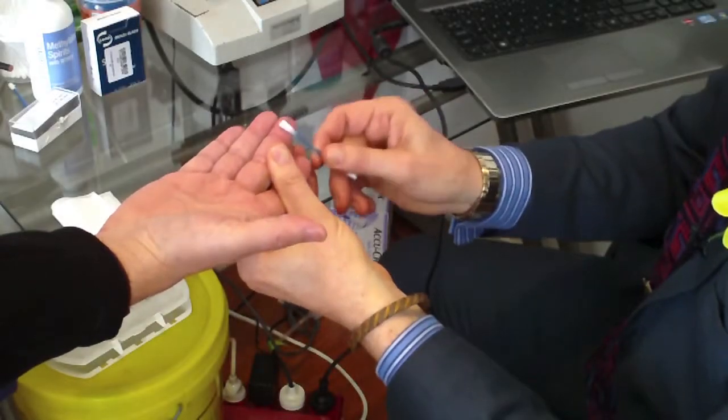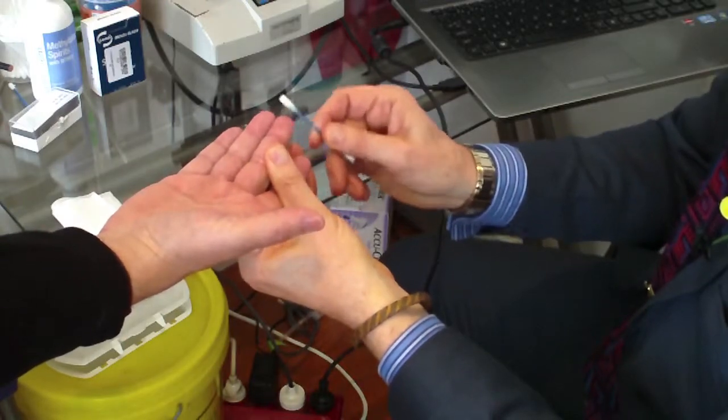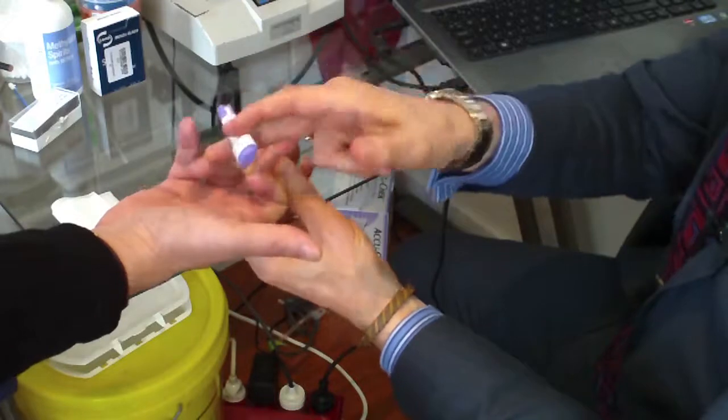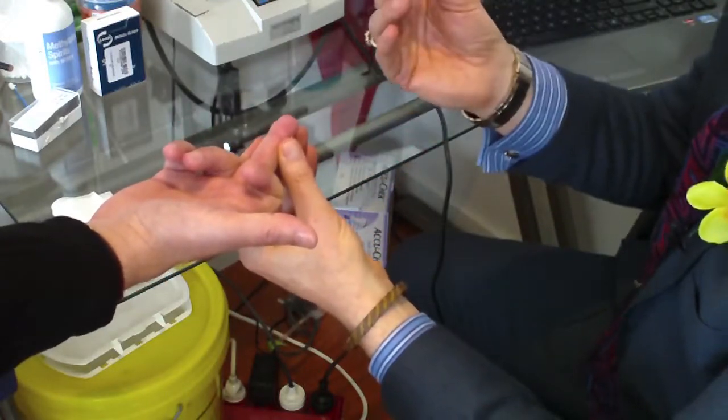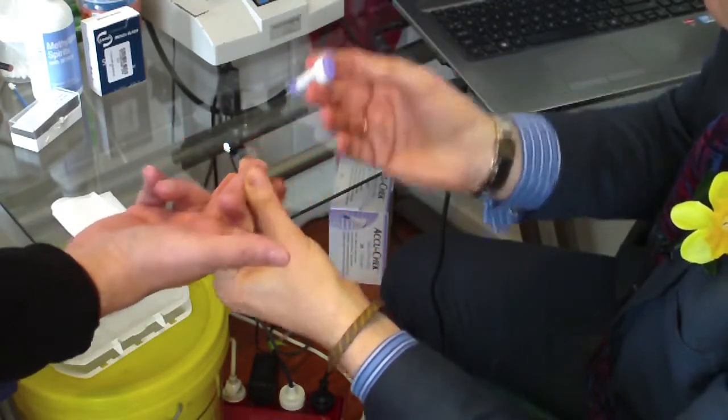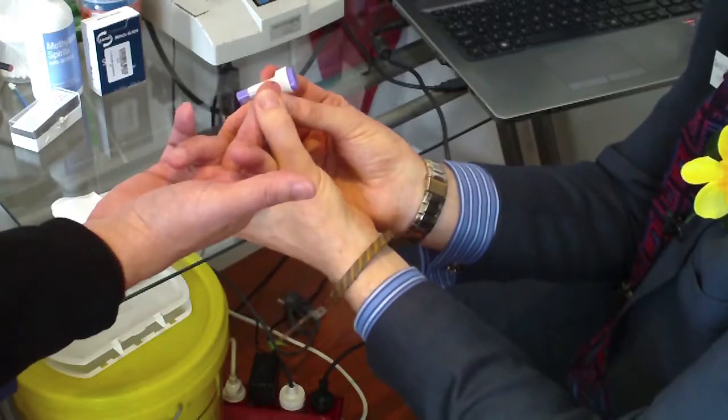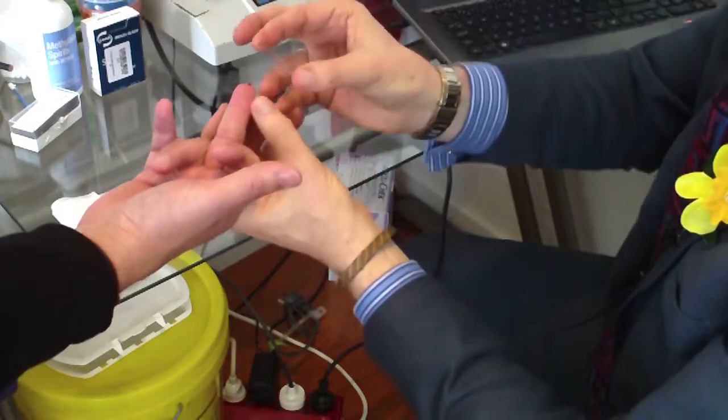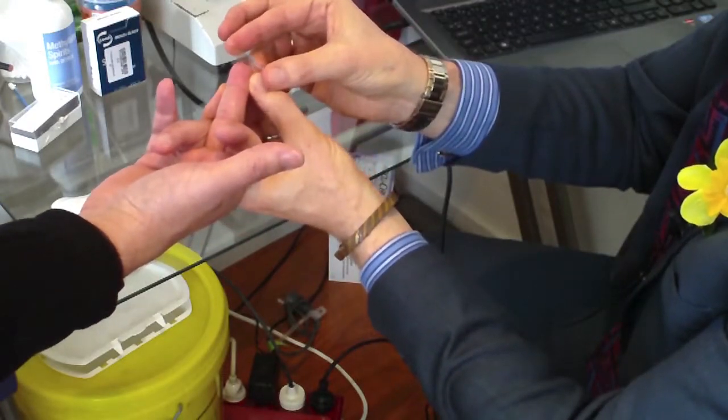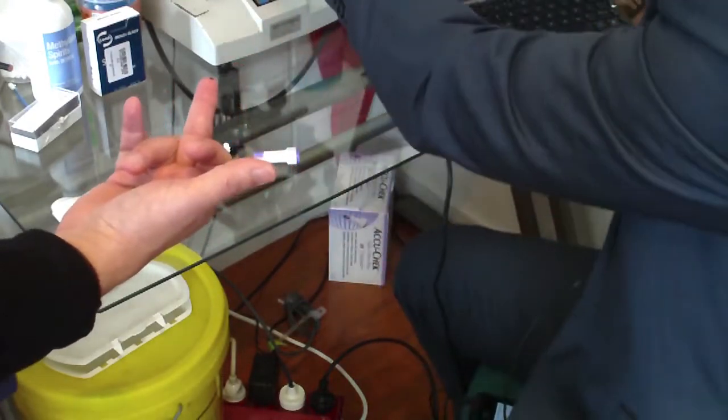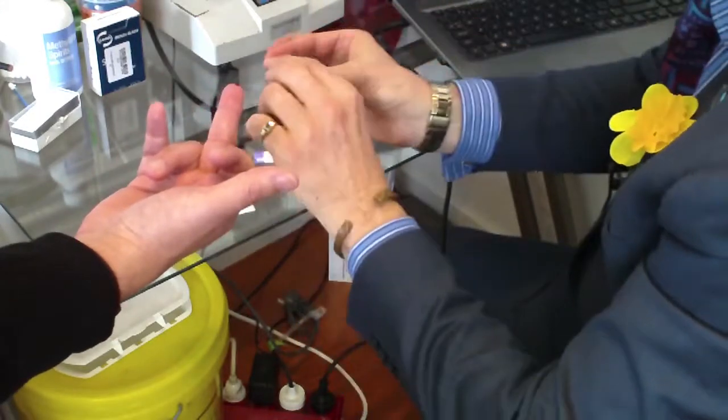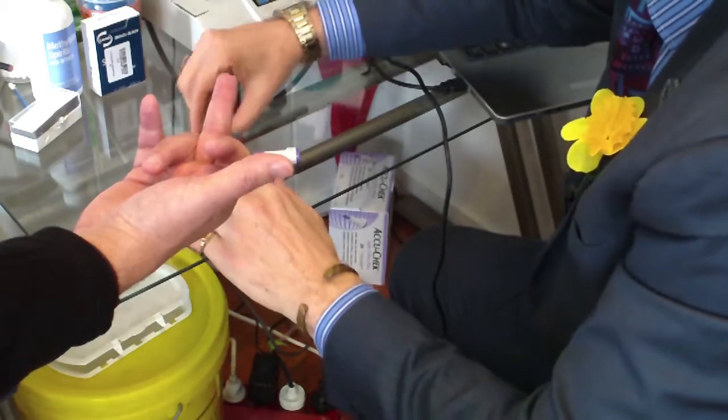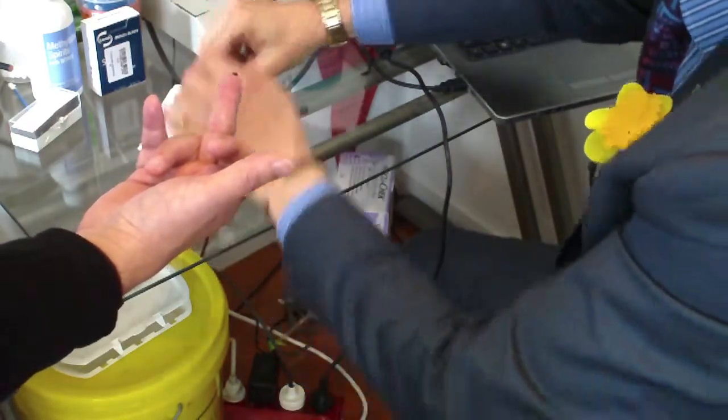If I can use you Gerald for your hand. So we're going to swab the patient's hand like this, we're using meths without stain in it. And if you can roll that finger back and that one back. So there's a special technique I'm using. Oops, sorry. There we go. So this is for the wet blood analysis.